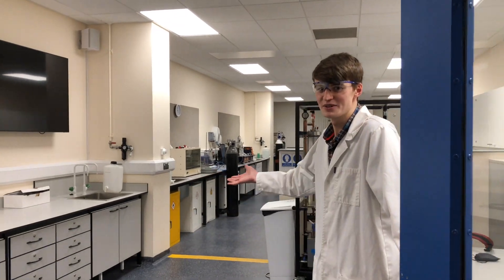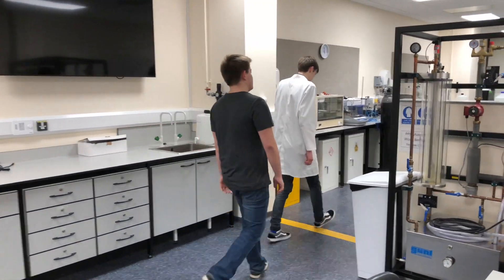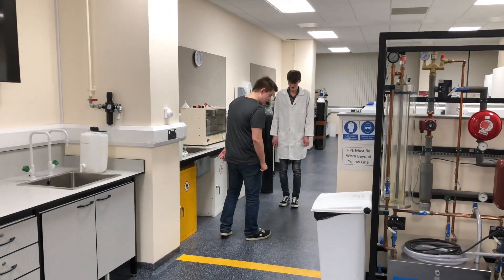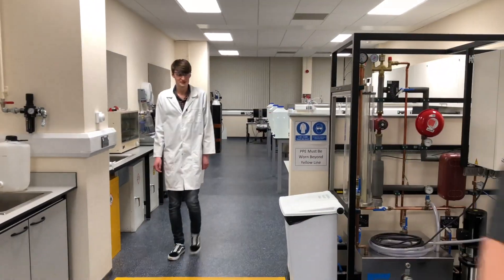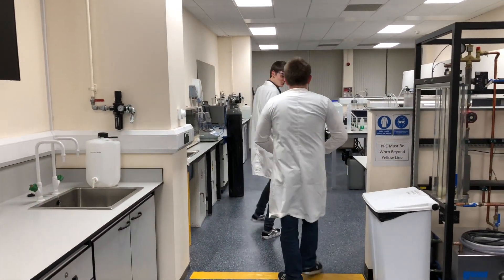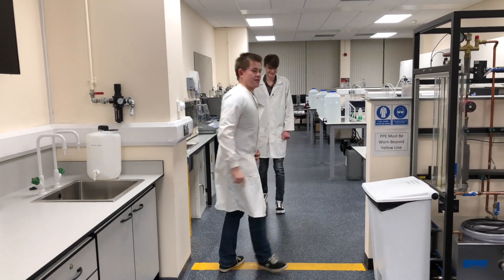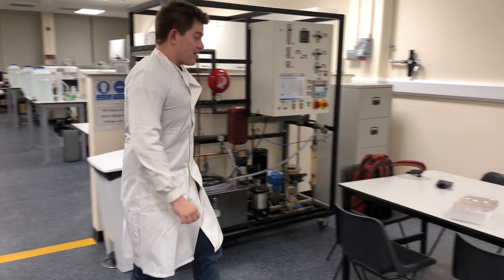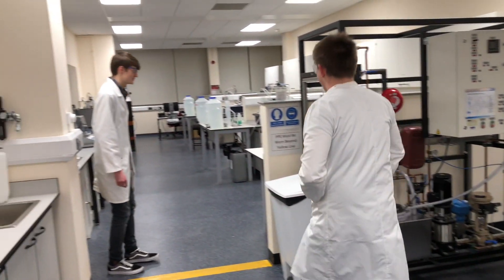Hello, welcome. I was expecting you. Perfect, and we're ready to start the experiments. Whoa, you're missing something. Oh, lab coat. Grab that. Got it shrunk in the wash. Whoa, you're still missing something. Some snazzy safety glasses. There we go. All set.